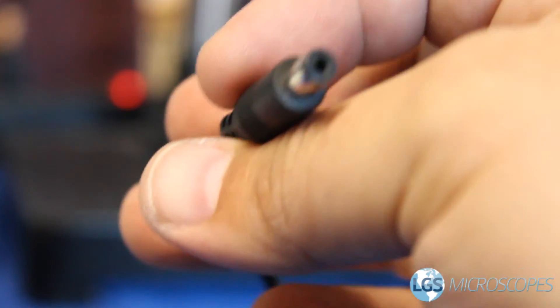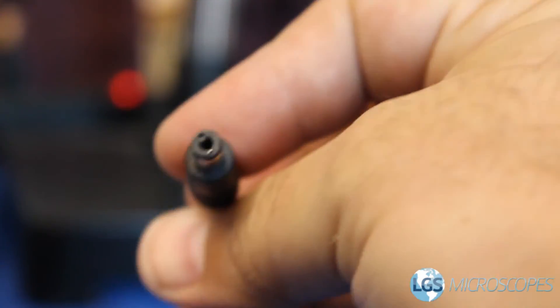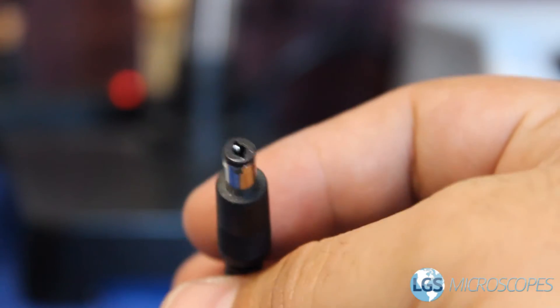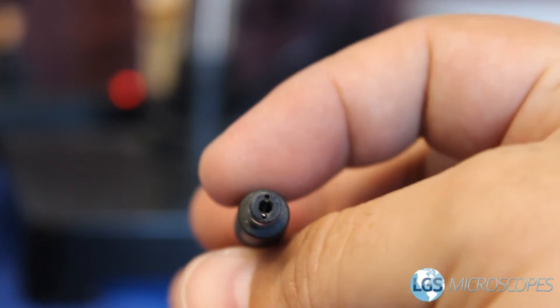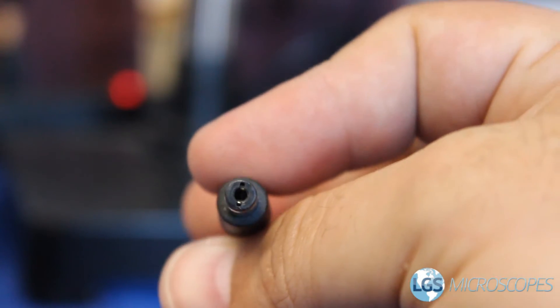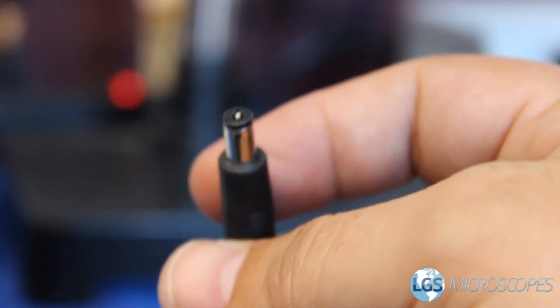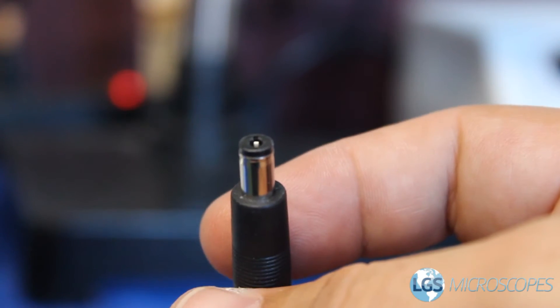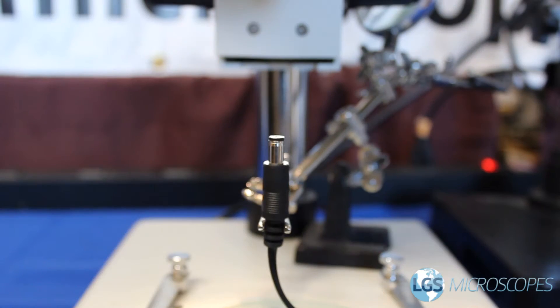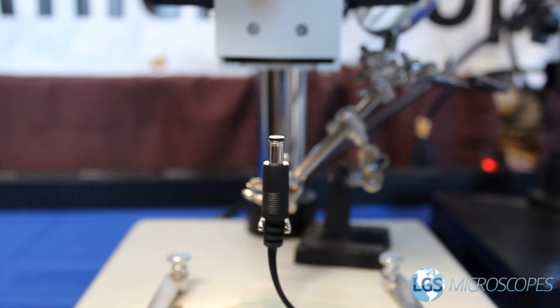In order to illustrate how parallax works, we're going to be taking a look at this part today — it's just the end of a power cord. You'll see these on a lot of household items, and you can tell that there's a shaft that runs down there. We're going to try to see down there using a stereo microscope. First, let's look at this part with it pointing straight up and down, like you might figure you're supposed to look at it.